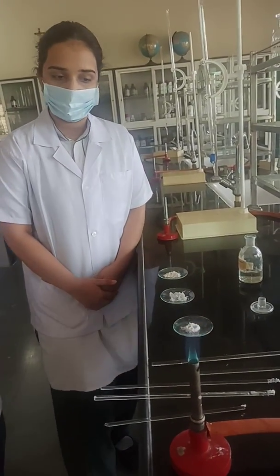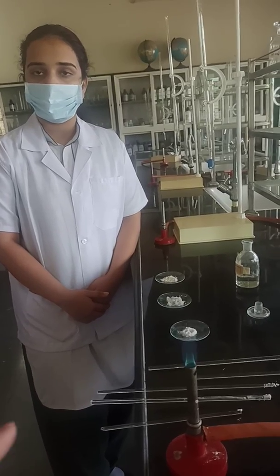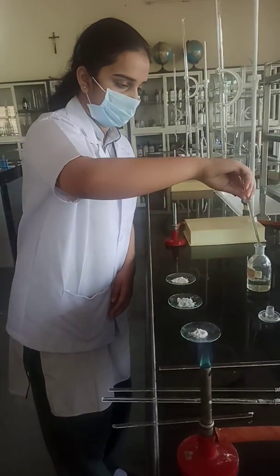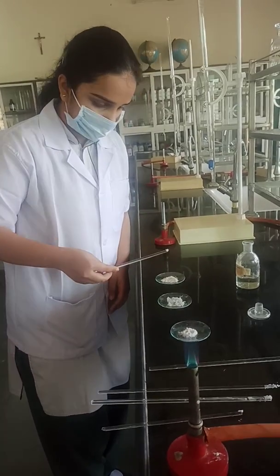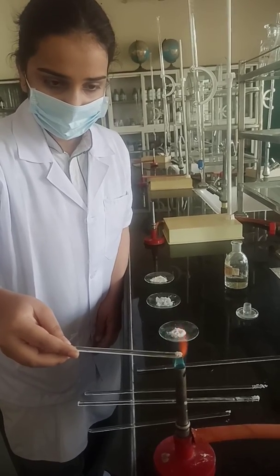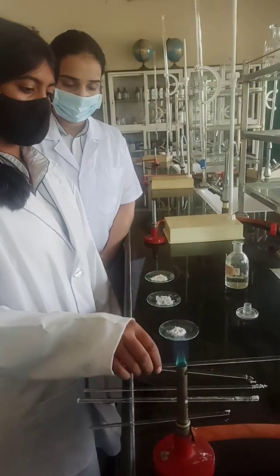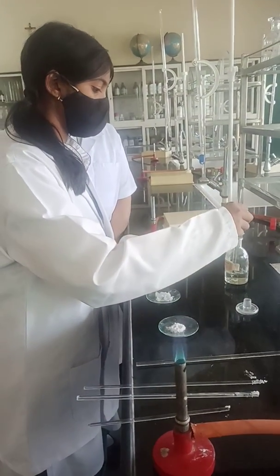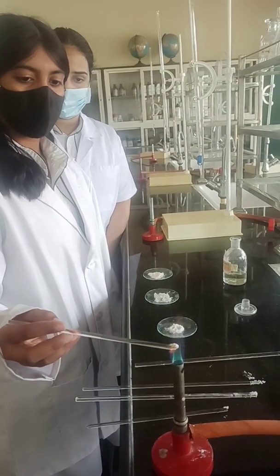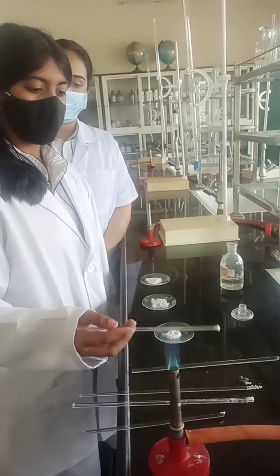And Bhavishya, which is the third salt? Calcium. It's the salt of calcium. So we are going to perform the flame test for calcium. Repeat the steps and show which colour you get for calcium. Again she has repeated the same steps — dip the glass rod in HCl, add some salt flakes. This is the brick red colour. Asmi, can you repeat for the last salt of calcium? Glass rod dipped in the HCl, some salt flakes. Orangish brick red colour is obtained.